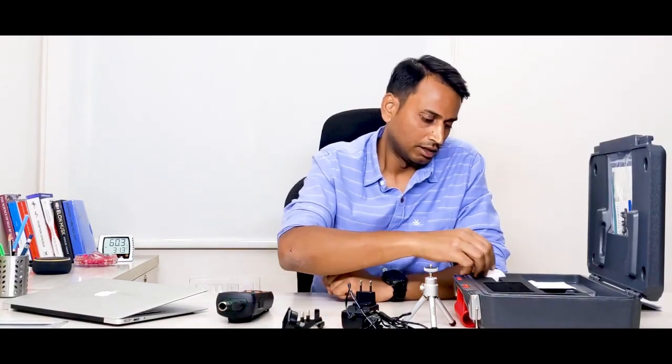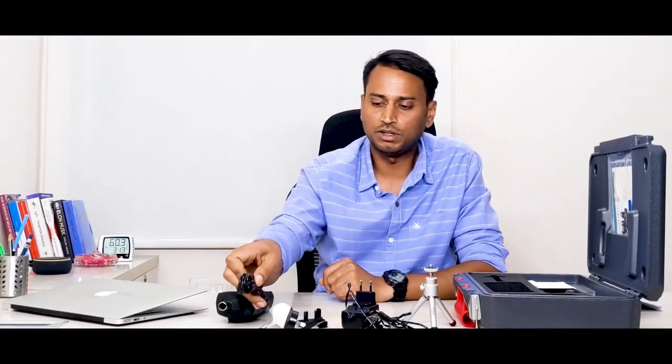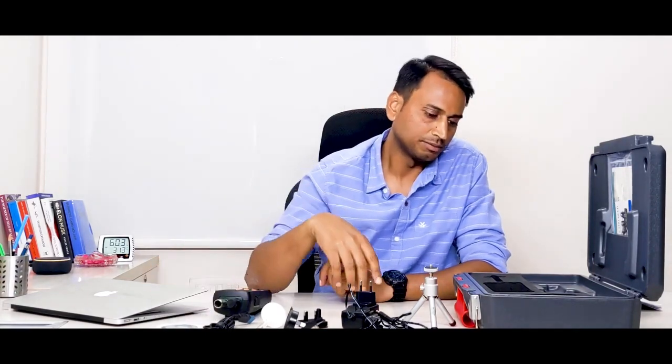For this, there is software in this device. It also takes English, German, French and Spanish as languages for this instrument. We have also got a sampling tube for pumping operation, and this is the cable which is used to connect to the PC. So we also have a software which can be connected to the PC. For this software to be connected, we need to use this CD along with it.